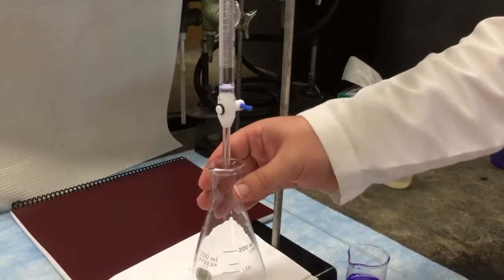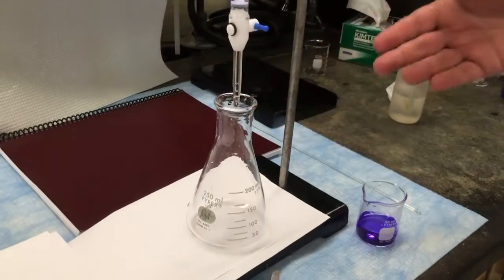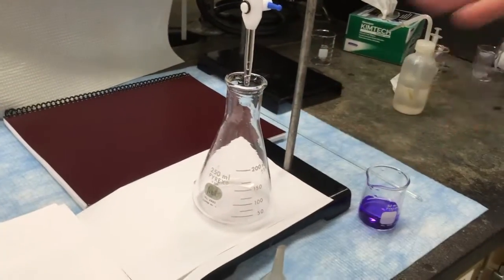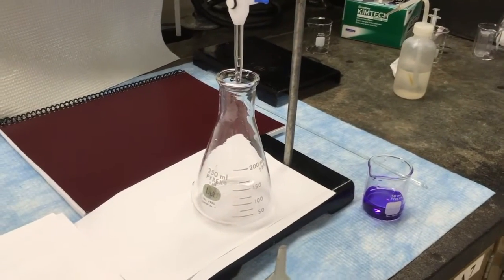Also, when you drain the burette, it's a good idea to have it go into an Erlenmeyer flask rather than a beaker. The Erlenmeyer is set up so that if there's any splashing, it stays in the container whereas otherwise it will go out of the beaker.